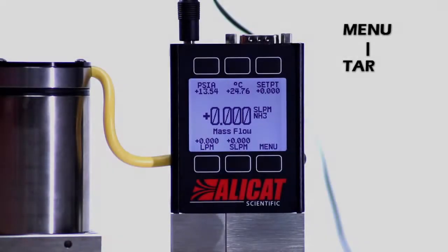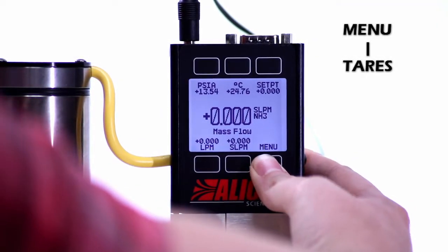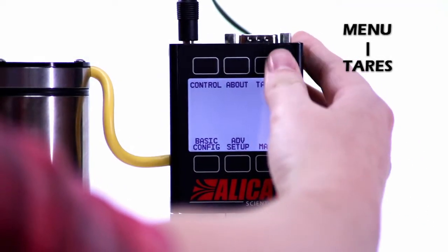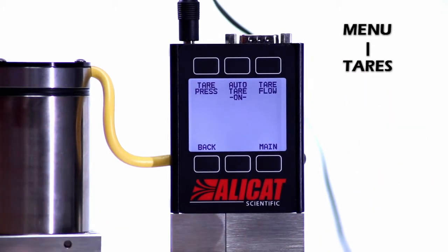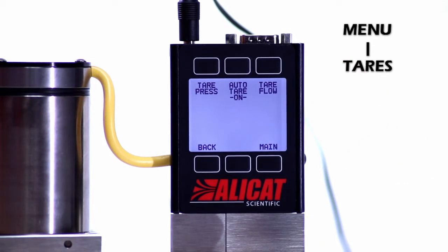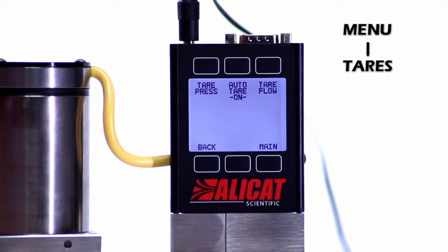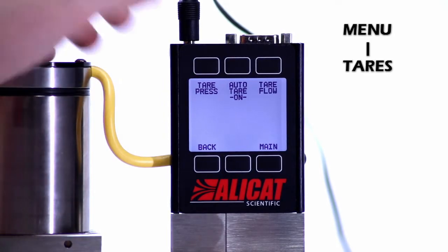To tare our unit from the front panel, we are going to go to the menu and then click Tares on the top right. From here you can see, from left to right on the top: tare pressure, auto tare on, and tare flow.